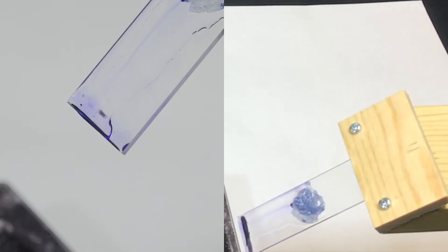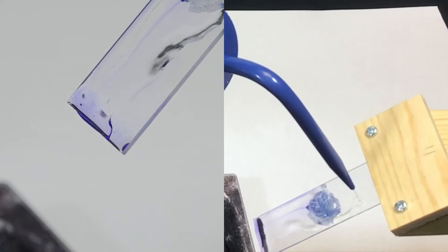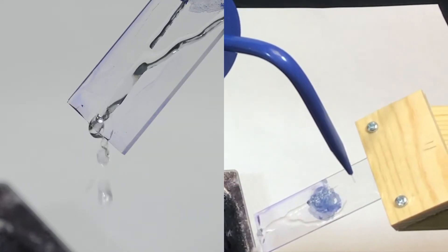When finished, I'm going to rinse immediately with distilled water. Again, spray above the smear, not directly on it.